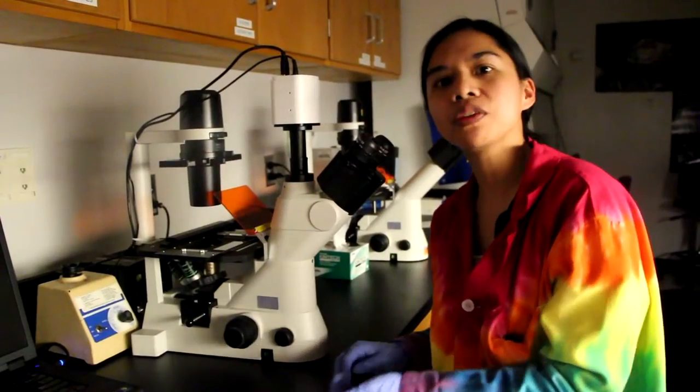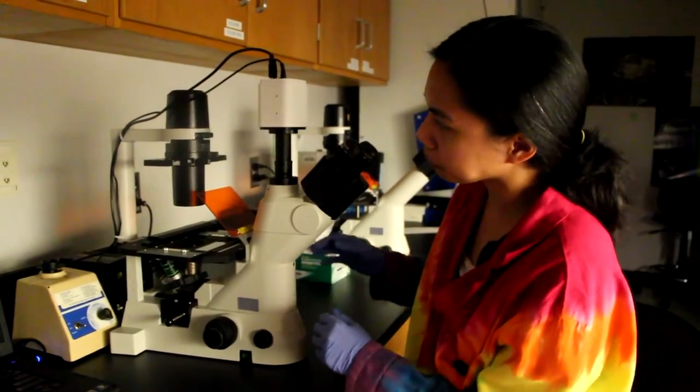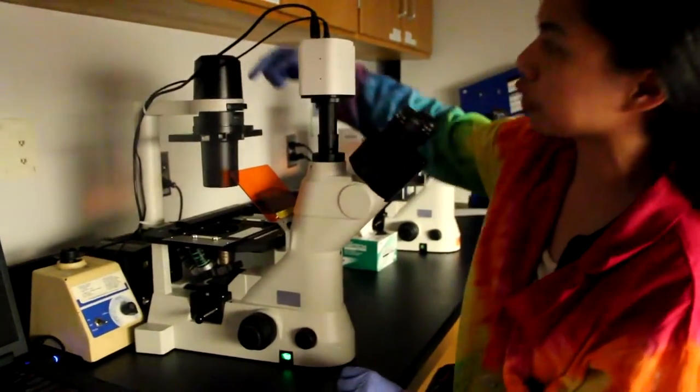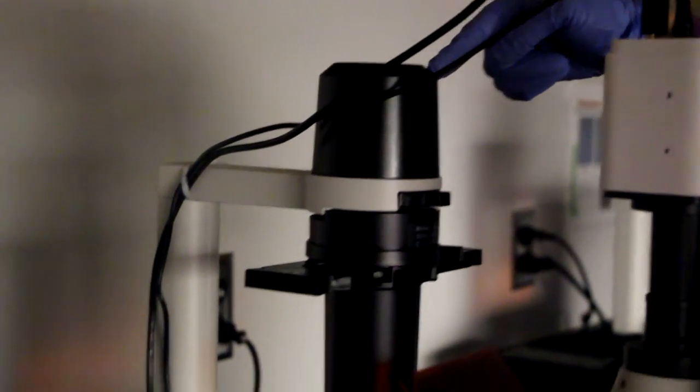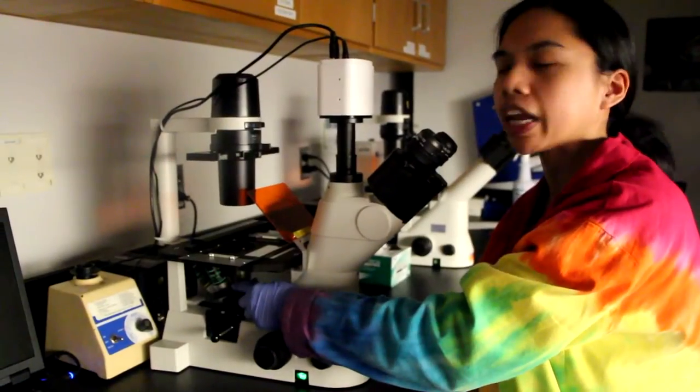I wanted to start with a little orientation of the different parts of the microscope. So first of all, the light source for this microscope is actually up here and passes through the sample down this way, and then the objectives are actually under the stage.